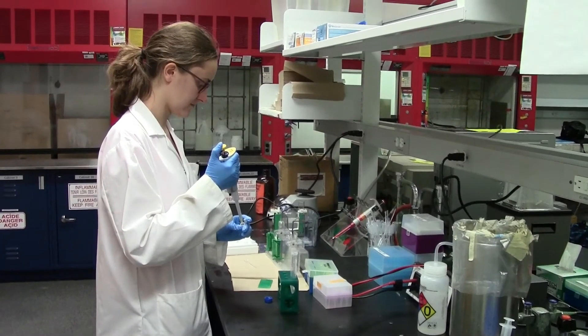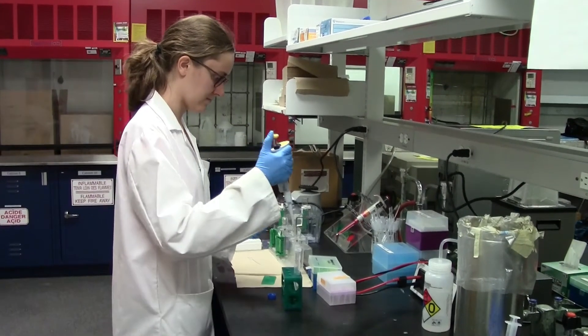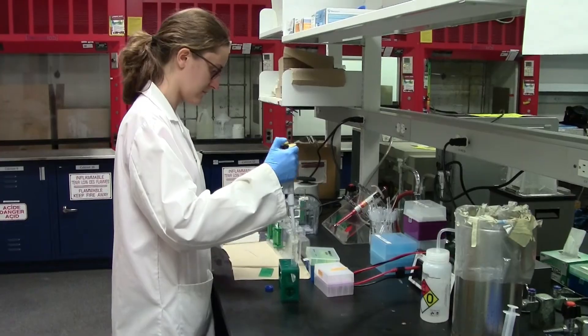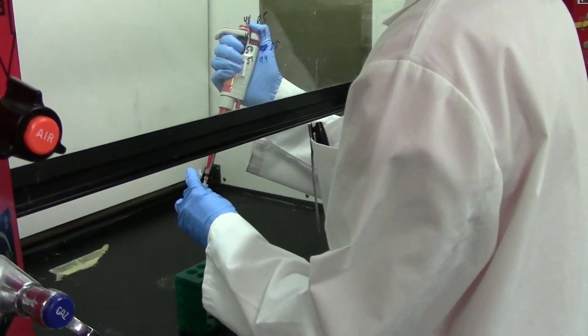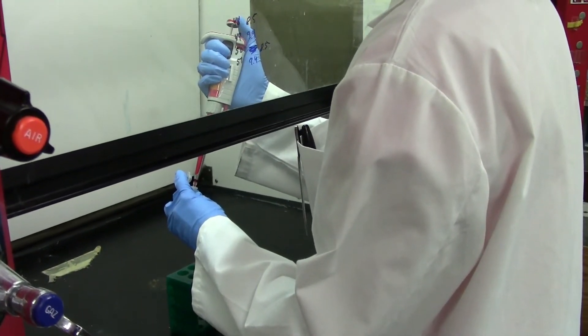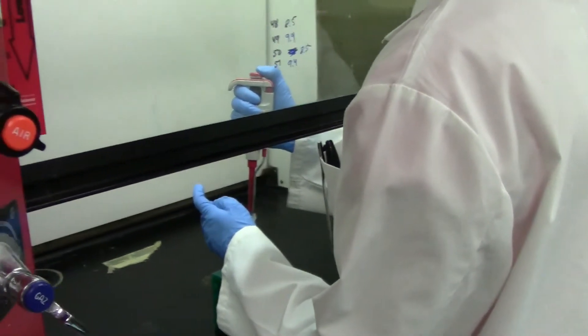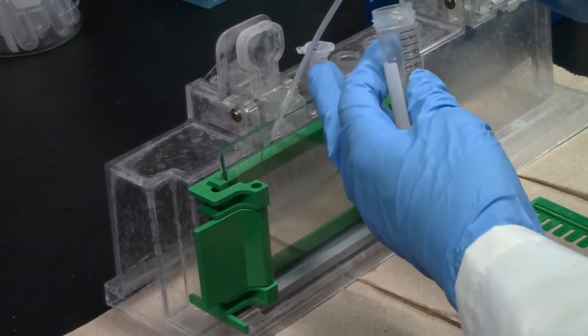To create the polyacrylamide gel, add 20 microliters of 20% ammonium persulfate and 10 microliters of TEMED to 5 milliliters of the desired PAGE solution, mixing well in between. Without delay, add the solution to the space between the plates using a disposable plastic pipette.